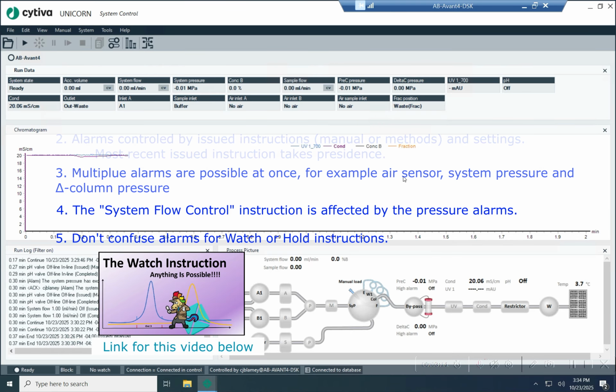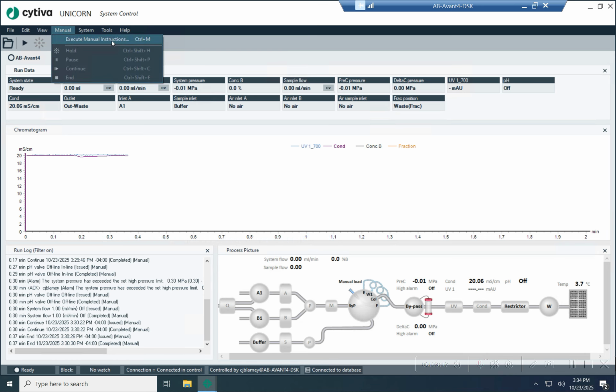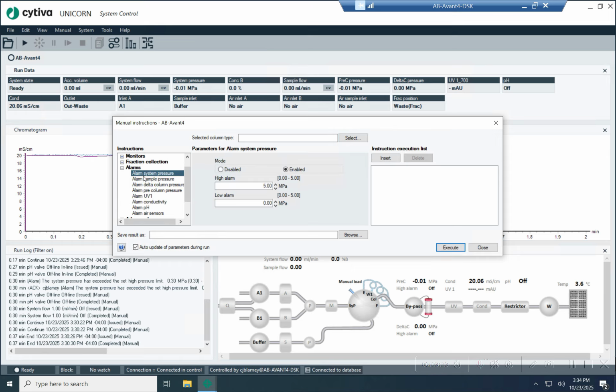Okay, so let's look at the instructions themselves. In manual, I'm going to go execute manual instruction, and then you can see the button here for alarms. And then we have an alarm for system pressure or sample pressure, and then delta column pressure and pre-column pressure. Both of these are controlled by the column valve, measured by the column valve. And then we have an alarm for UV or conductivity or pH, which I generally don't use, but they can be very handy in particular situations. So I understand why they put those in there. And then you also have an air sensor alarm, which you can either enable or disable. So very straightforward.